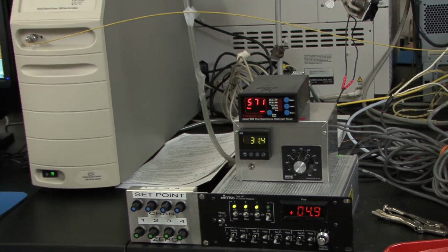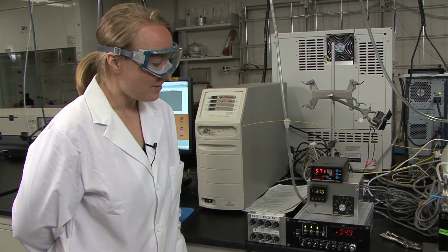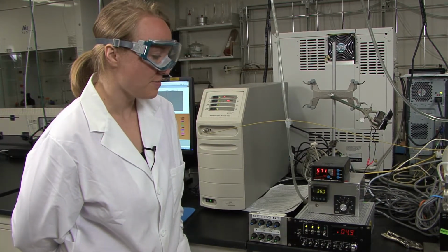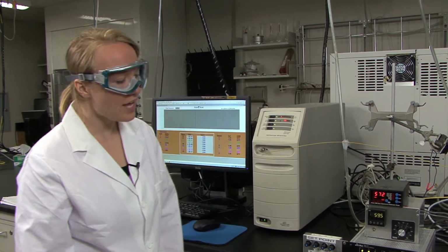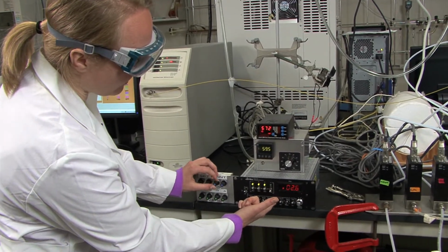And you'll want to repeat this process for all 5 of your temperatures. Have your lab partner watch the temperature readout, and they can adjust the dial if the temperature starts to drop too quickly, which might be the case at the hotter temperatures. After you're done with your temperature determination, you'll need to do an argon purge. So to do that, you'll want to turn off the flow rates for the oxygen and the ethylene.